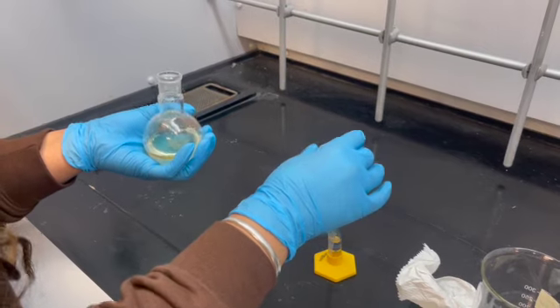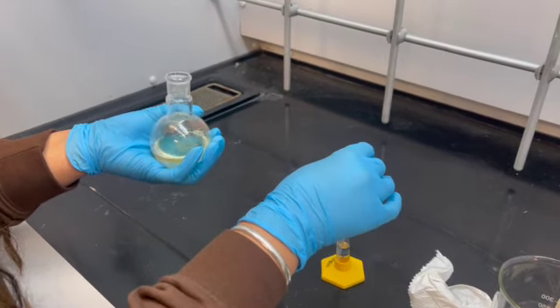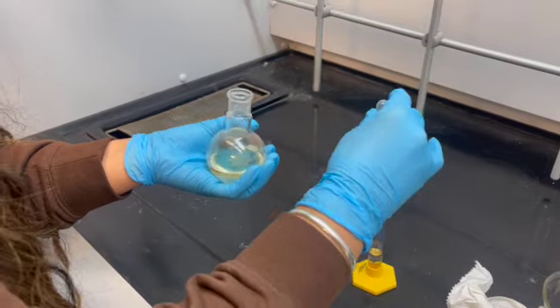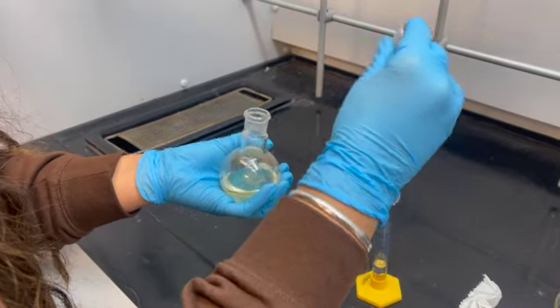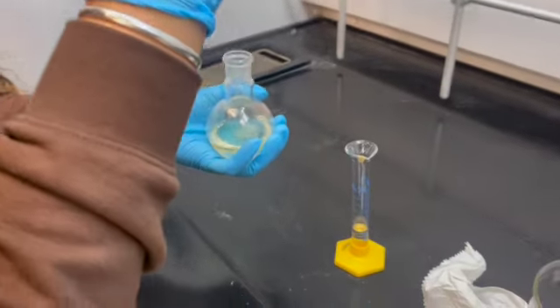At this point, we are going to add more HCl acid to our mixture to see if that would help out with the liquefaction of this solid. 20 drops.